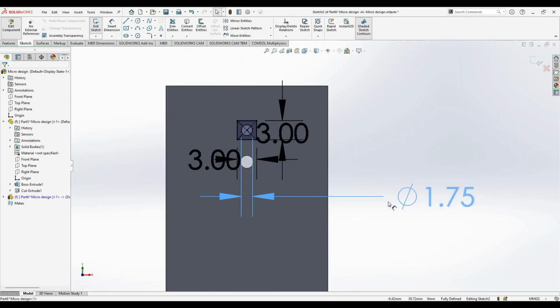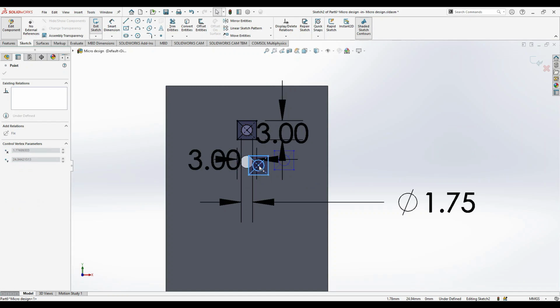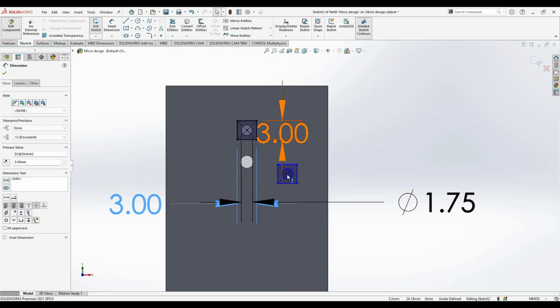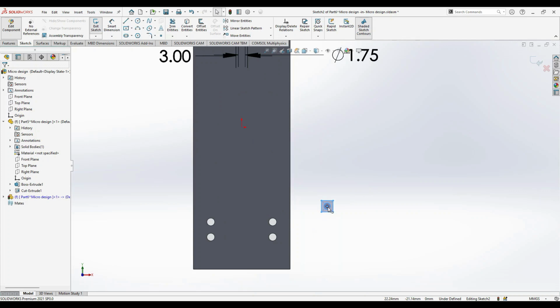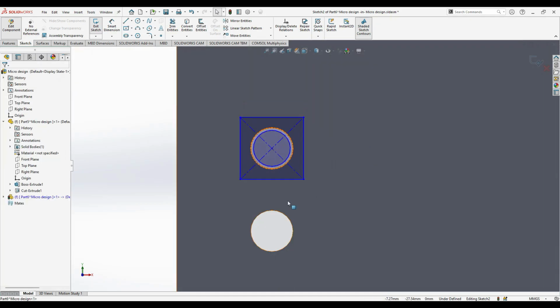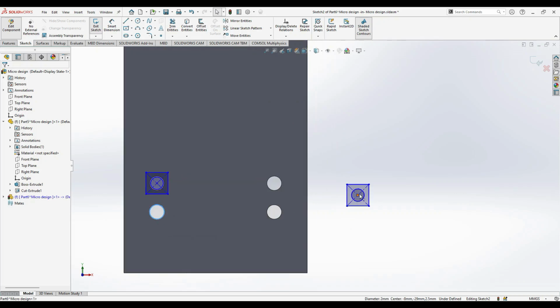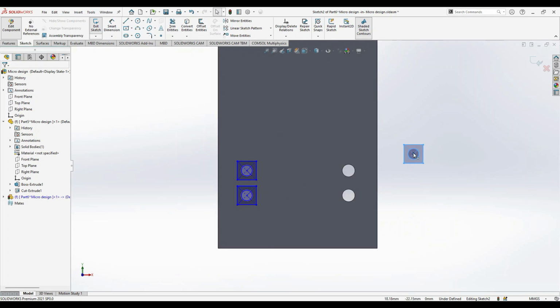And to do the second one, just copy this, paste, and then connect this. You can connect this hole to this circle, and we can connect this. And the other one also we can connect to this. And now if you want, you can connect to this directly, or the same way you can do the mirror. So I just prefer to connect.